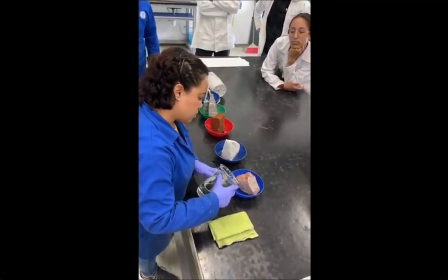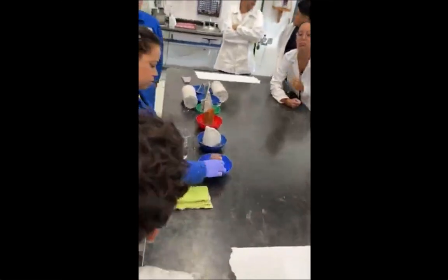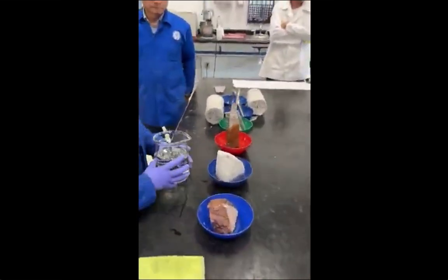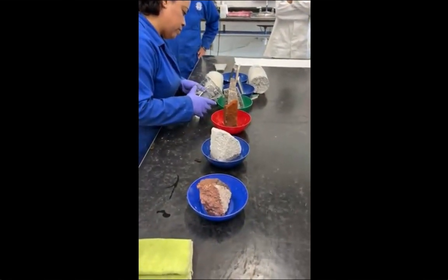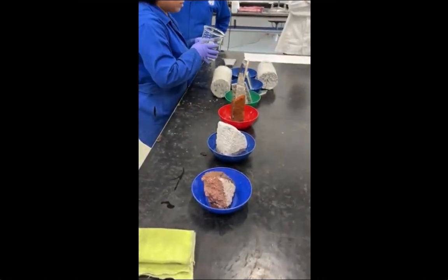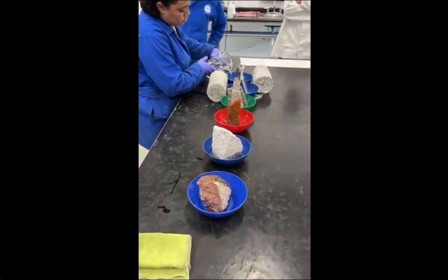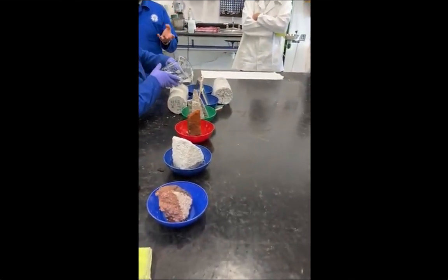And for the procedure, each of the ceramic pieces was kept in a plastic container for the experiment, enabling regulated exposure to the test solution. Then some sodium sulfate solution was poured to the bottom of each container. This chemical was used as a medium to simulate the ambient conditions that encourage salt absorption and efflorescence in ceramics.